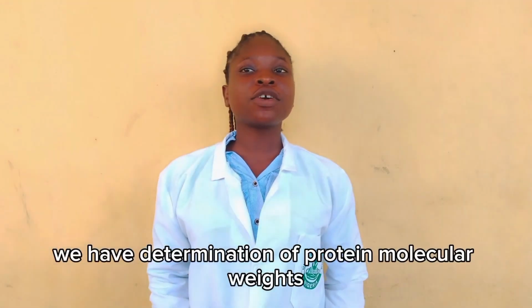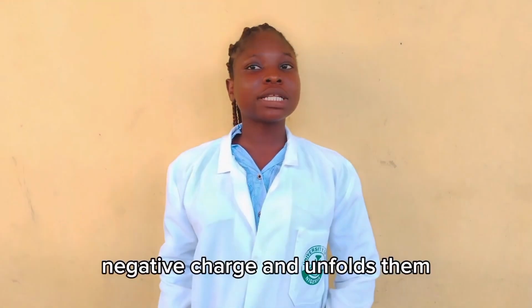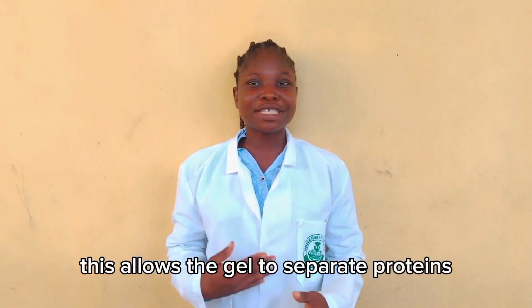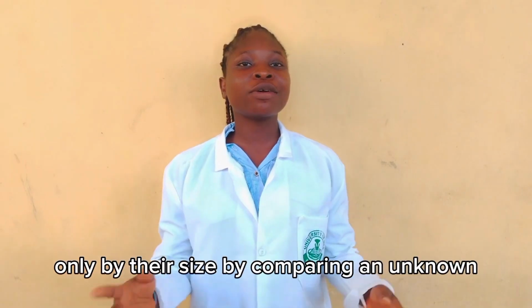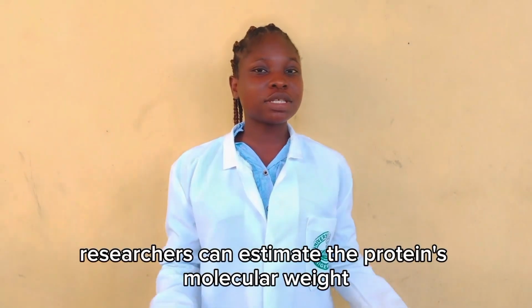We have determination of protein molecular weight. Under that, SDS coats proteins with a uniform negative charge and unfolds them. This allows the gel to separate proteins only by their size. By comparing an unknown protein band to a known molecular weight marker, researchers can estimate the protein's molecular weight accurately.